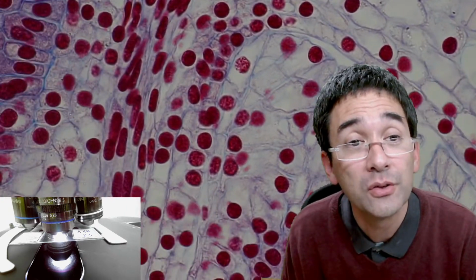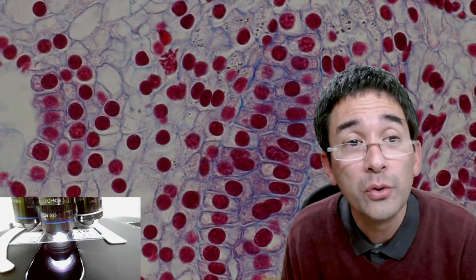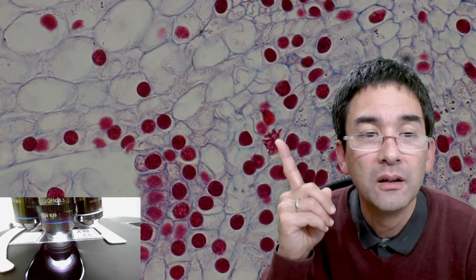But the reason why I've been doing this, or one of the reasons, is not only because I wanted to talk about cell division, but simply also to show you a little bit that sometimes when you look at a slide, you see those things, but you just overlook them because you don't know what you're supposed to look at. Okay? And then things don't make sense. And sometimes if you know a little bit of the biological background, then it becomes a little bit more interesting.